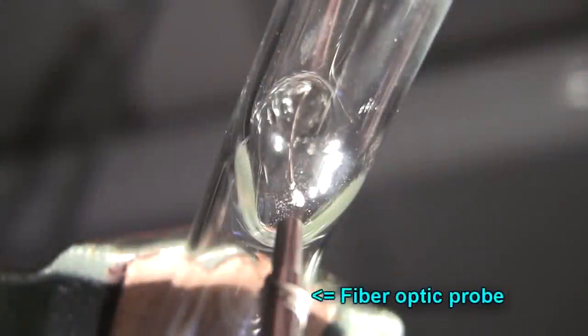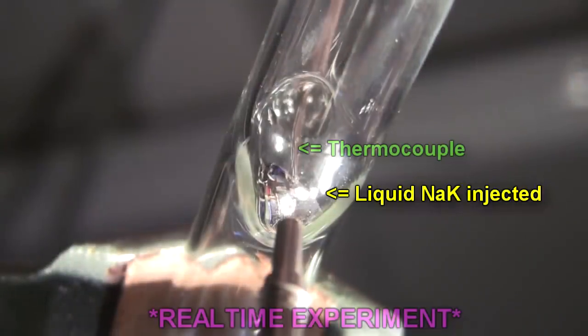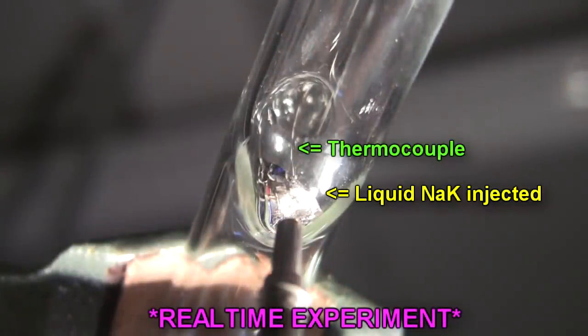Well, it turns out that blue color skin, you can actually recreate that independently by just putting a drop of water onto sodium potassium alloy.